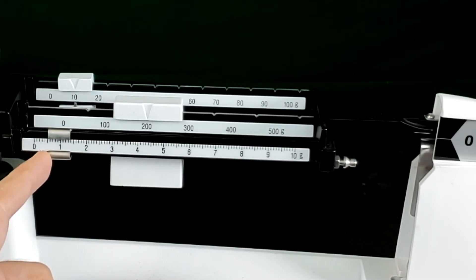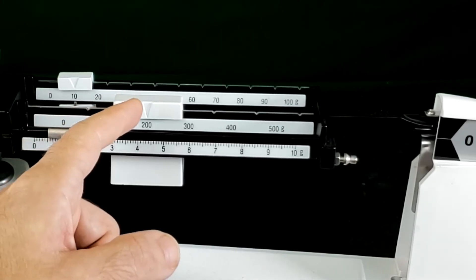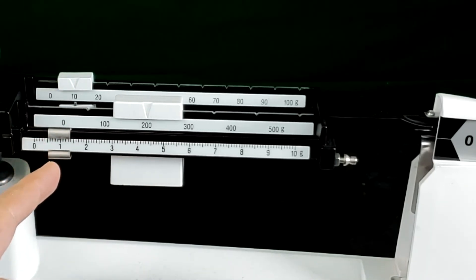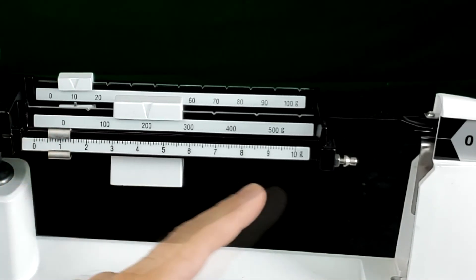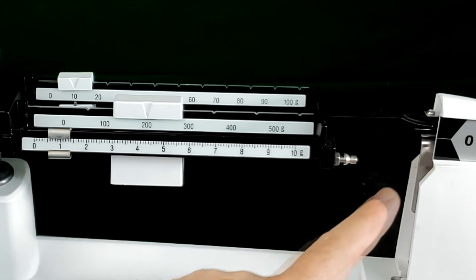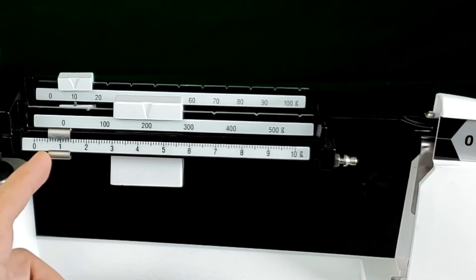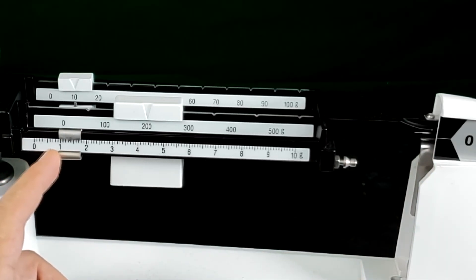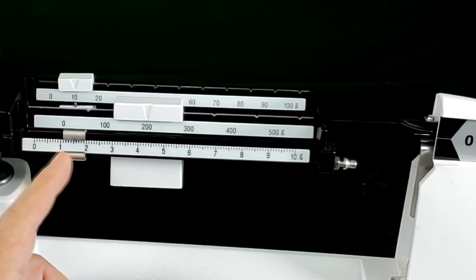If it were right here that would be 200 plus 10 plus one or 211, but you can see my zero pointer is not quite there yet so I'm going to keep sliding this over very gently.